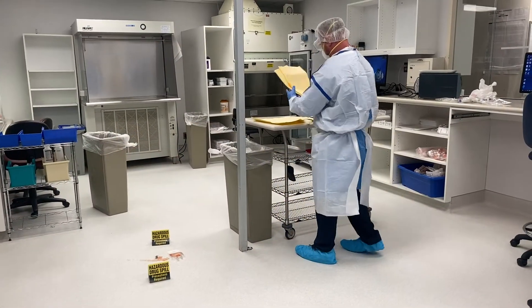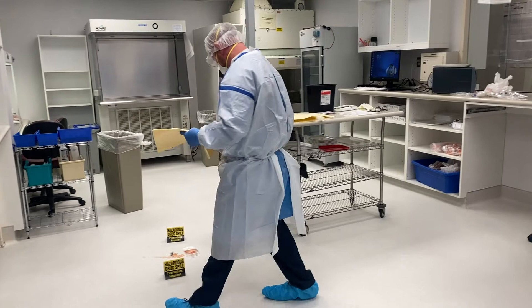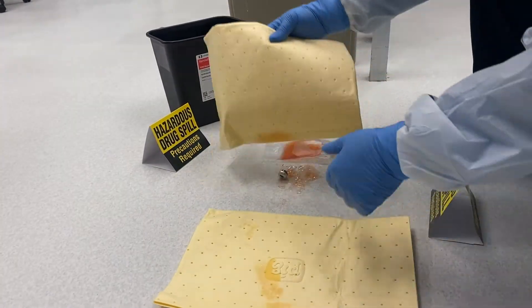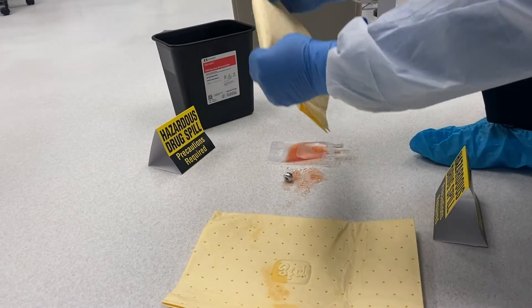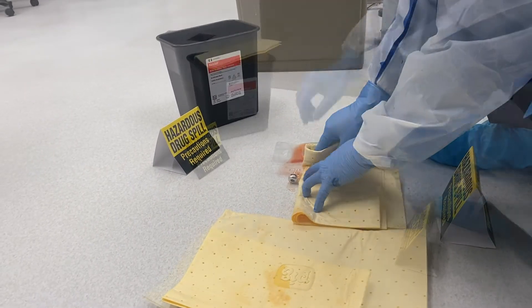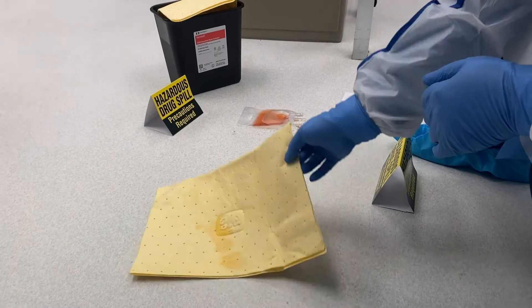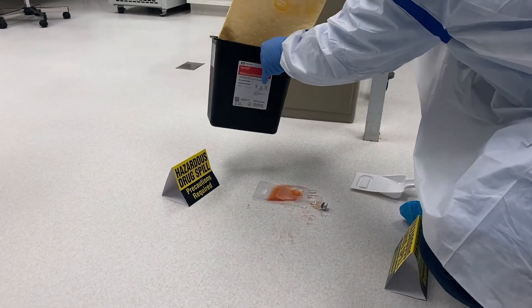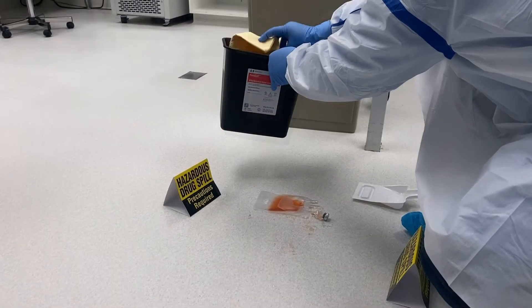For liquid spills, place enough of the absorbent towels over the spill carefully, not touching the HD spill. Allow time for the towels to thoroughly absorb the material. Once the absorbent towels are saturated, place them in the black RCRA waste container. Repeat these steps if necessary.